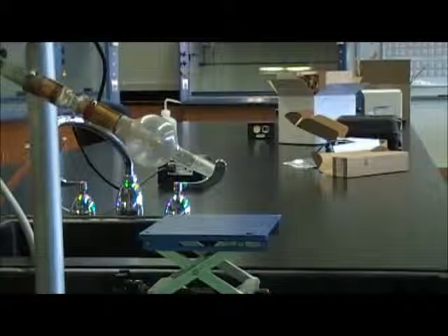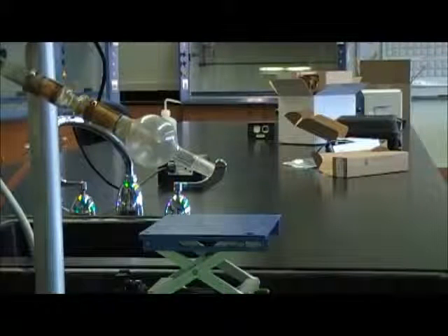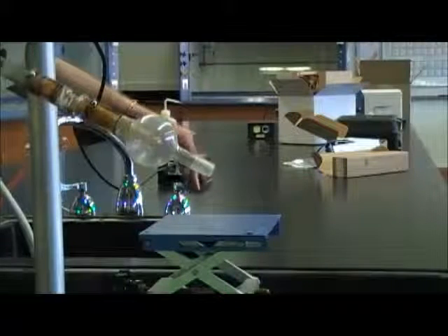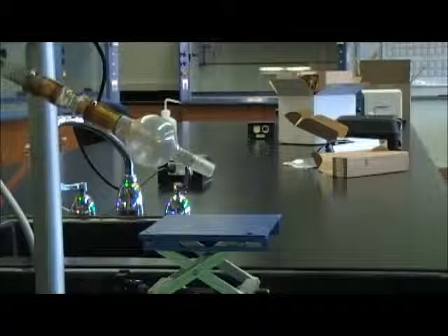The whole thing will be under a vacuum because it's attached to an aspirator over here. I'm going to go ahead and turn it on.